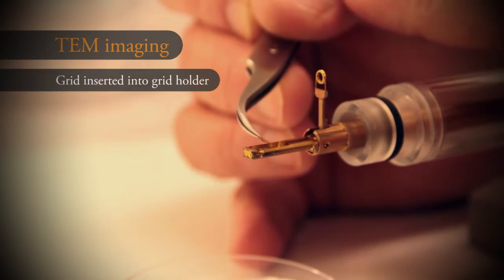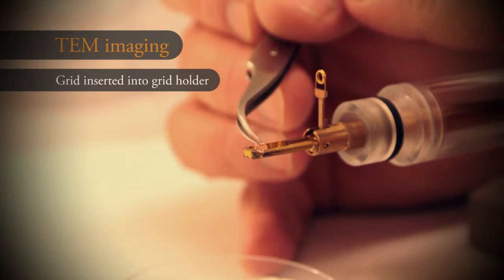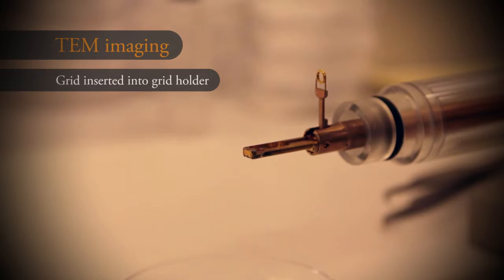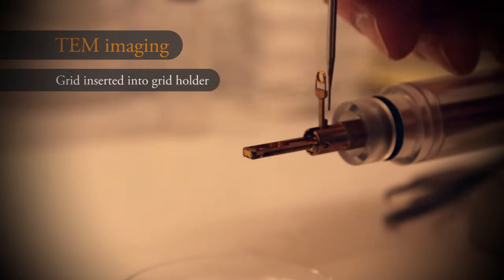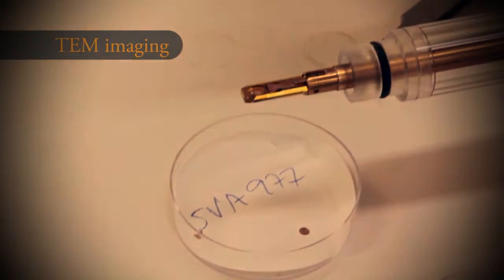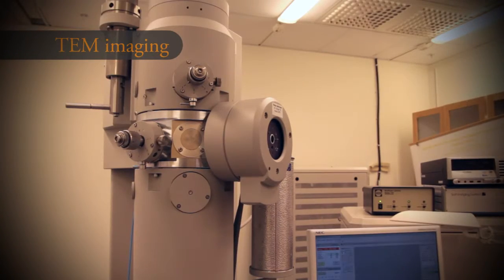The tiny sample grid is placed in the holder and inserted into the electron microscope. This open view method is able to detect interesting structures in the sample regardless of whether they are known viruses or new ones.